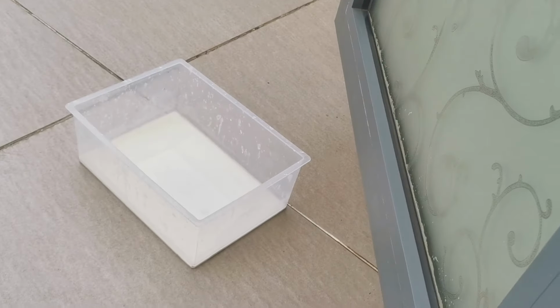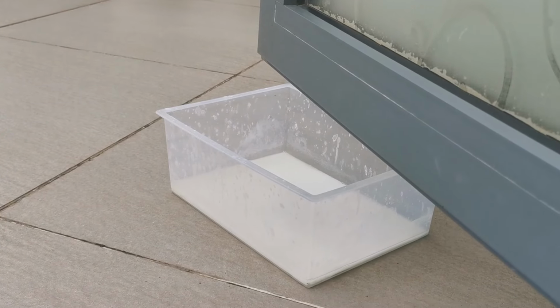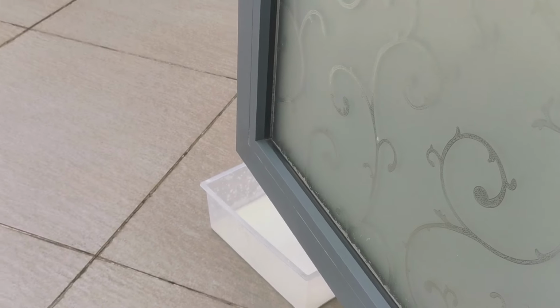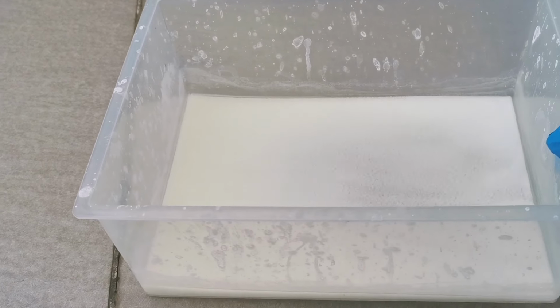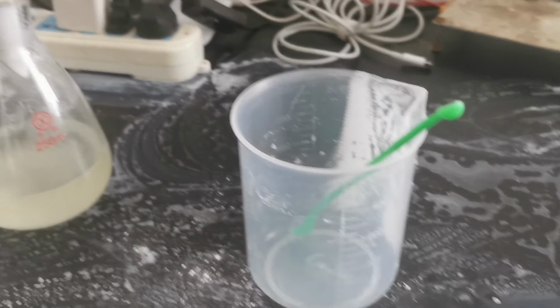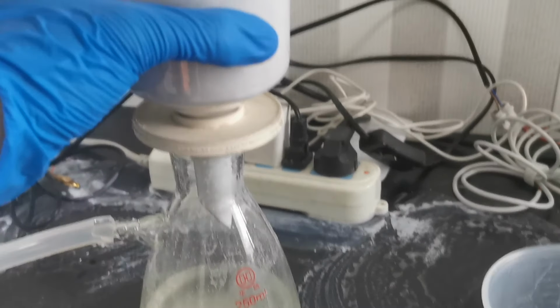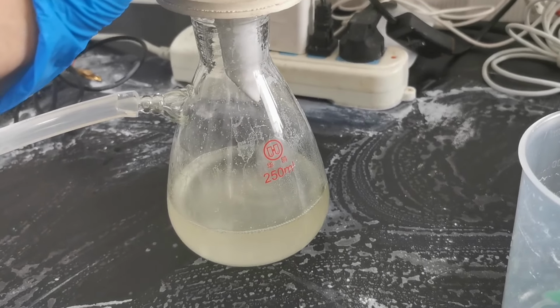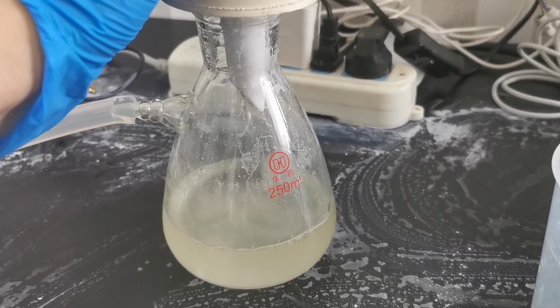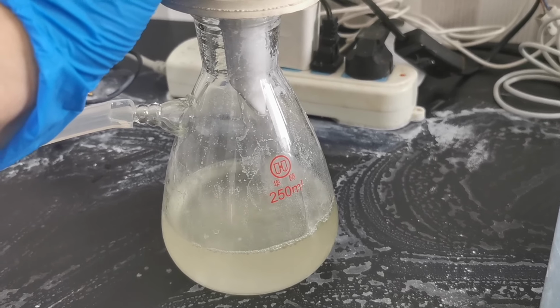Fortunately, I still have enough DCE for another experiment, so I quickly ran through all of the procedures just as before. This time I placed the mixture in a plastic box, and it quickly started to react, producing a bunch of cyanuric acid precipitate and releasing a lot of hydrogen chloride gas. I filtered the precipitate off and stored the filtrate temporarily. Maybe the bottle I stored it in had some residual water that reacted with the benzoyl chloride, assuming that it had actually formed, so that could also be a potential factor of failure.